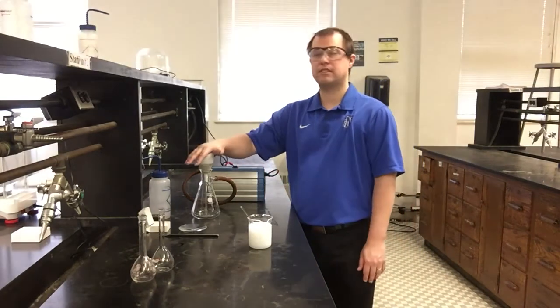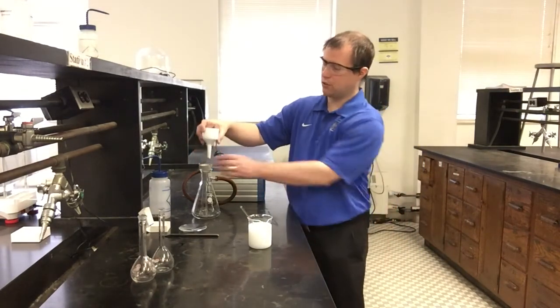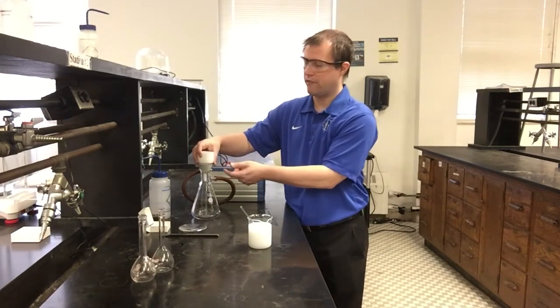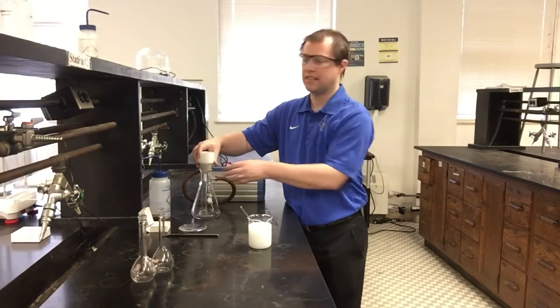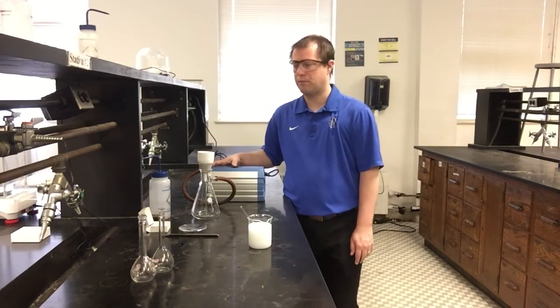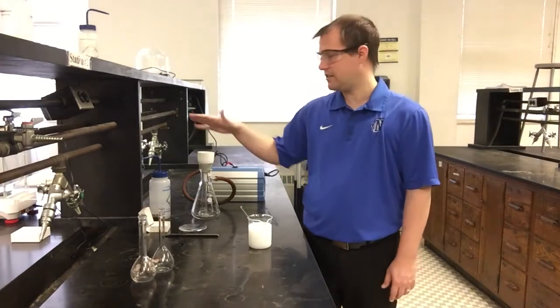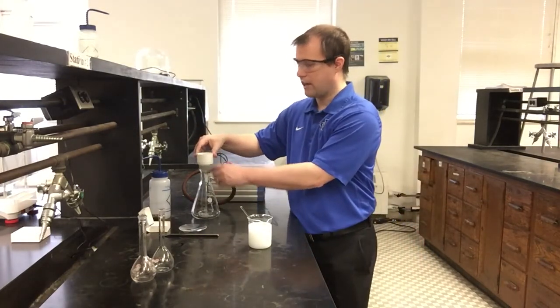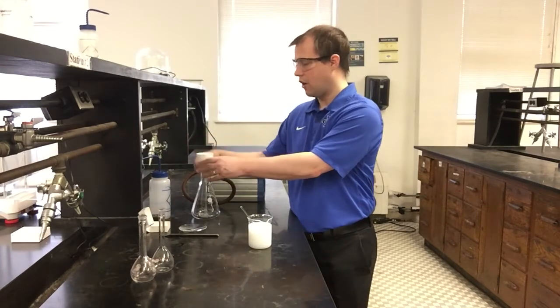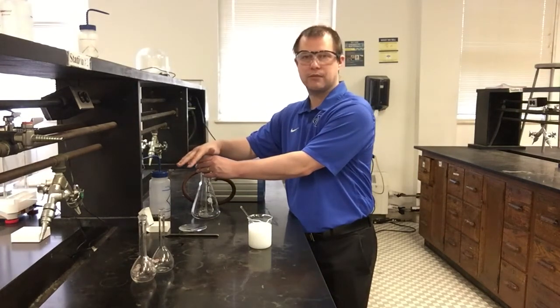Now, the next piece of this for my vacuum filtration, you're going to notice I have a little rubber adapter here. This is so that I get a good airtight seal between my funnel itself and this actual kind of sidearm flask that I have hooked up to a vacuum pump. And what I'm going to do, I'm going to go ahead and turn this vacuum pump on. You can probably hear the hiss, and you're going to see a little bit of water that I poured through on the filter paper initially to kind of wet it and make a nice seal already start to get pulled through, and you can check how much vacuum it's pulling.